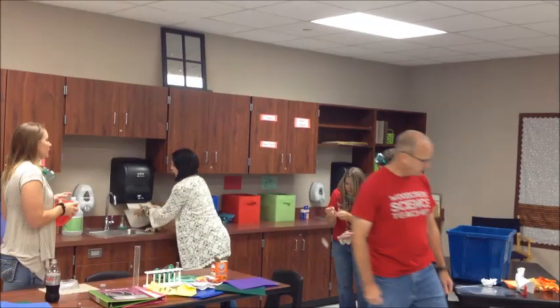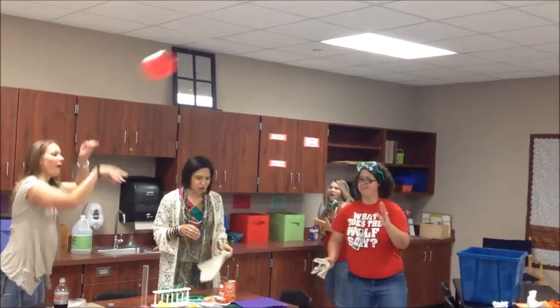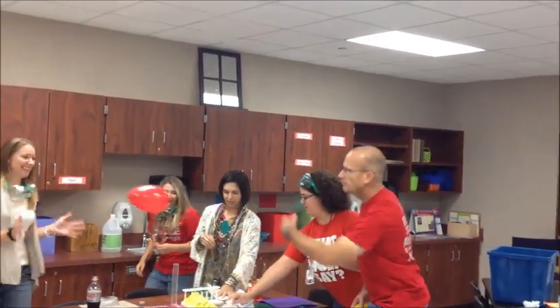Instructions for the lab for the day. Make sure that you have all the equipment ready to go. There were instructions?